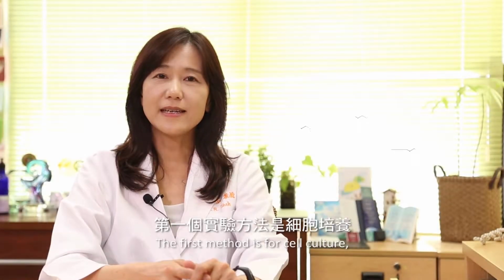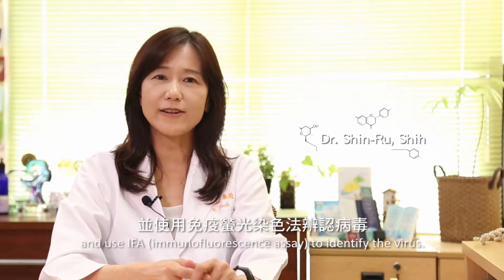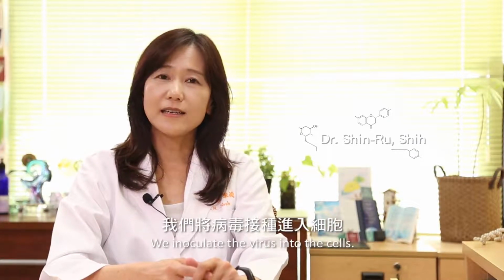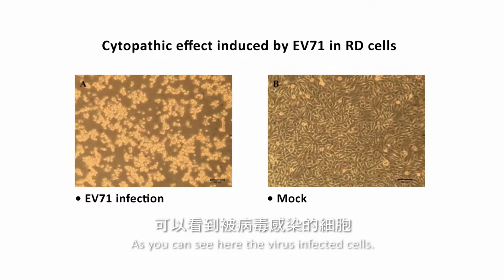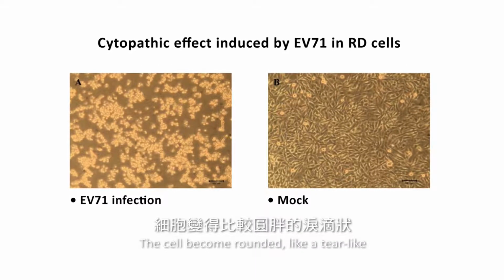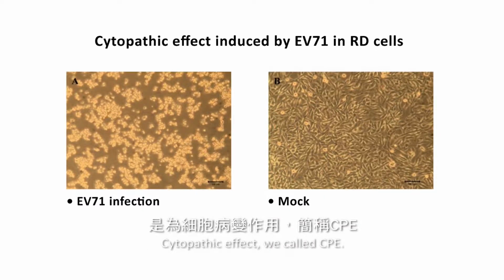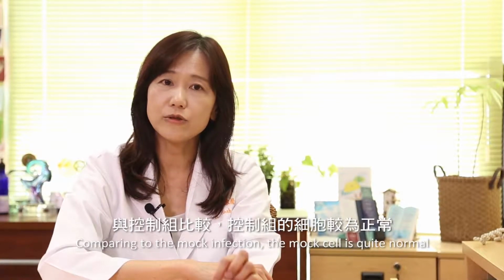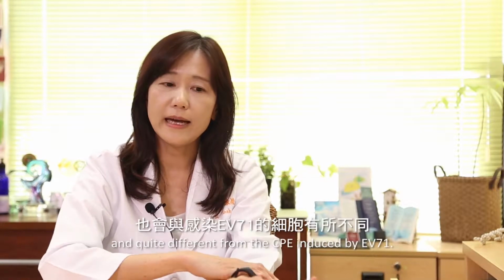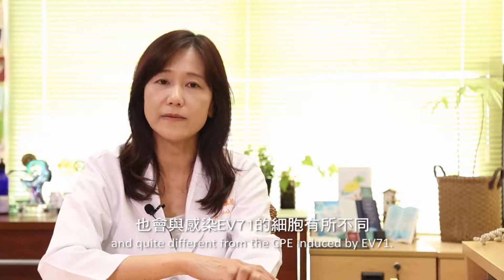The first method is cell culture and using IFA to identify the virus. We inoculate the virus into the cells. As you can see here, the virus infects the cells, which become rounded, like a tear-like cytopathic effect, which we call CPE. Compared to the mock infection, the cells are quite normal, and quite different from the CPE induced by EV71.